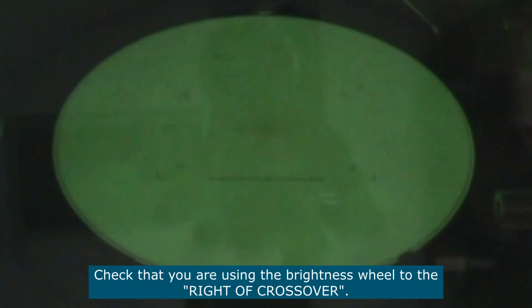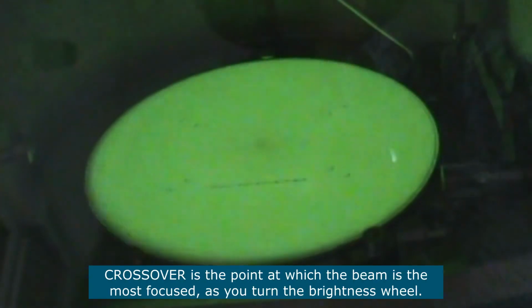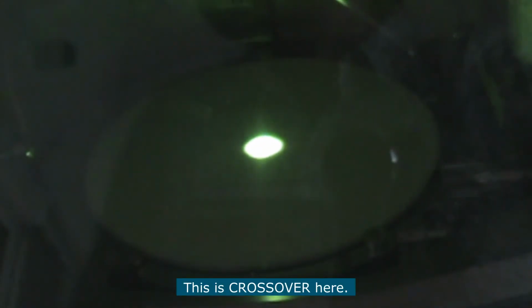Check that you are using the brightness wheel to the right of crossover. Crossover is the point where the beam is the most focused as you turn the brightness wheel. This is crossover here.